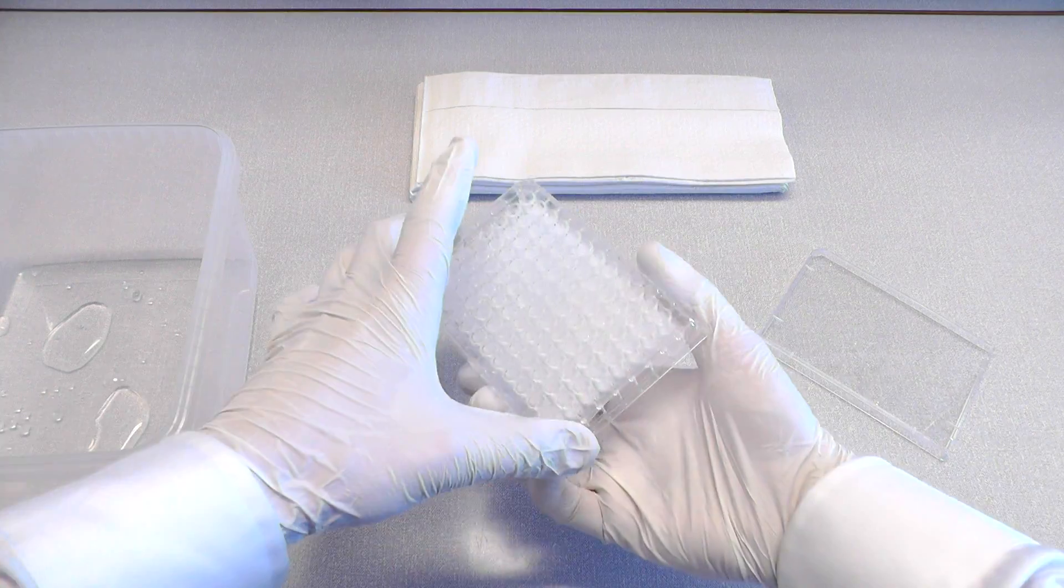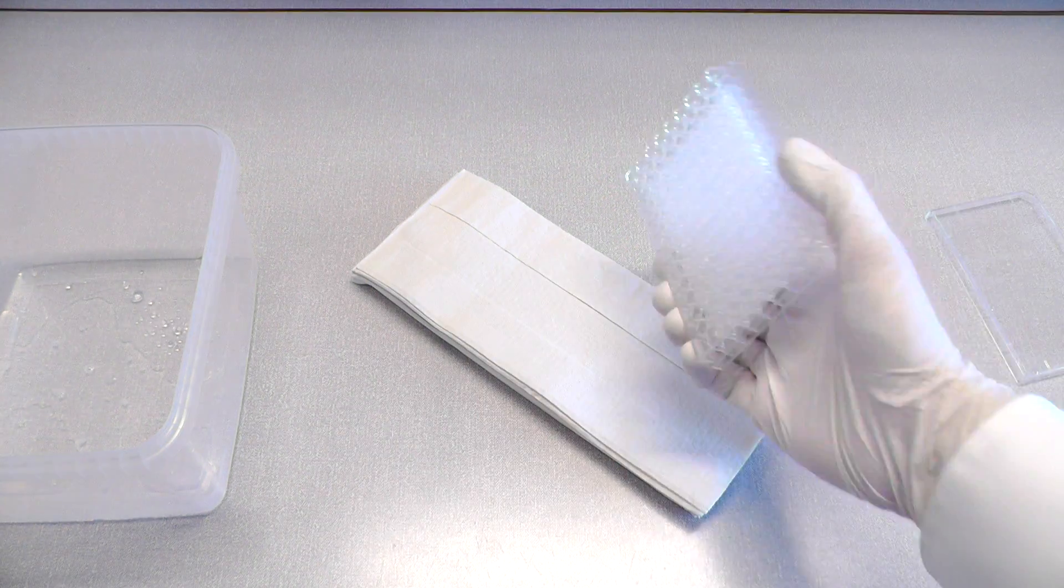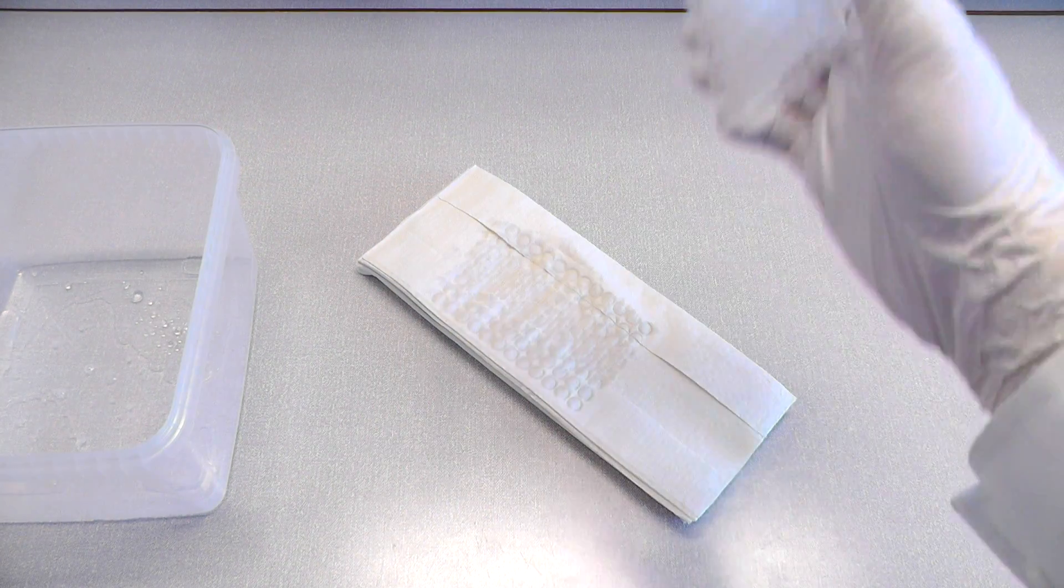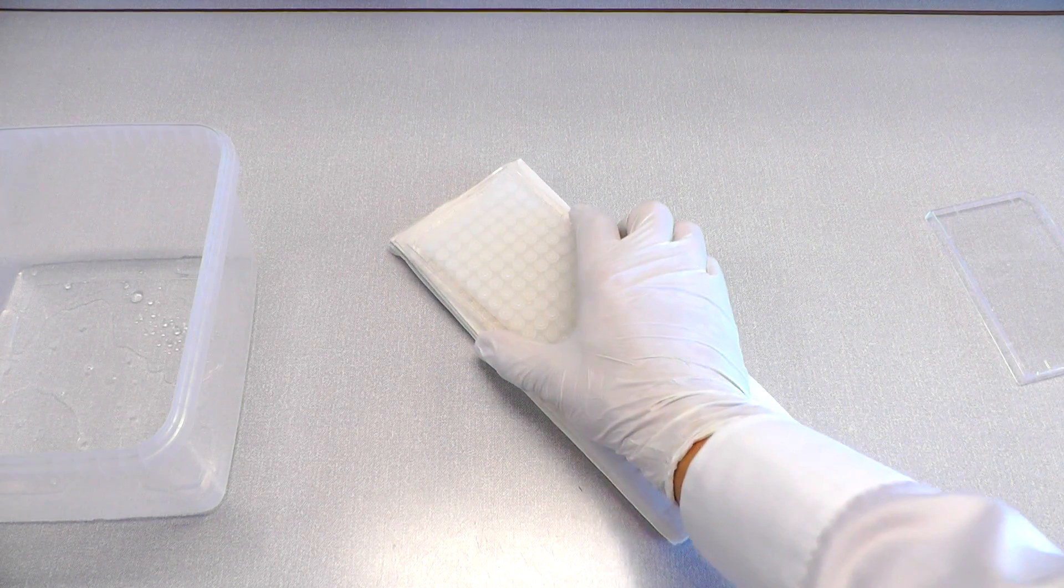After 15 minutes, the incubation is done and the solution is discarded. However, before the plate can be dried, we need to make sure any residual enhancer is removed by firmly tapping the plate against a paper towel that is free of fluorescent particles.